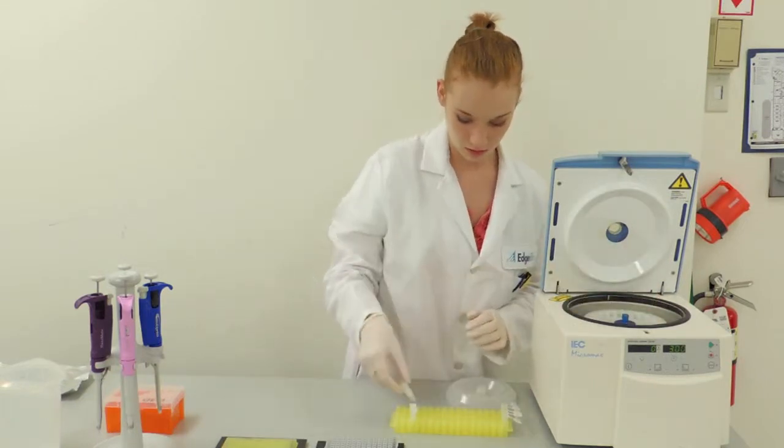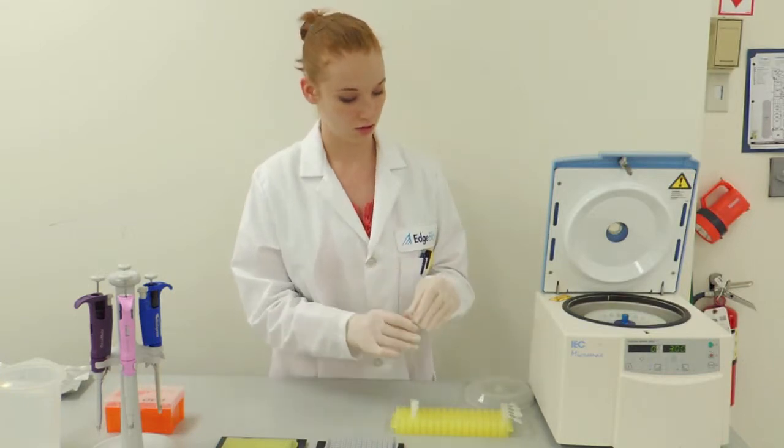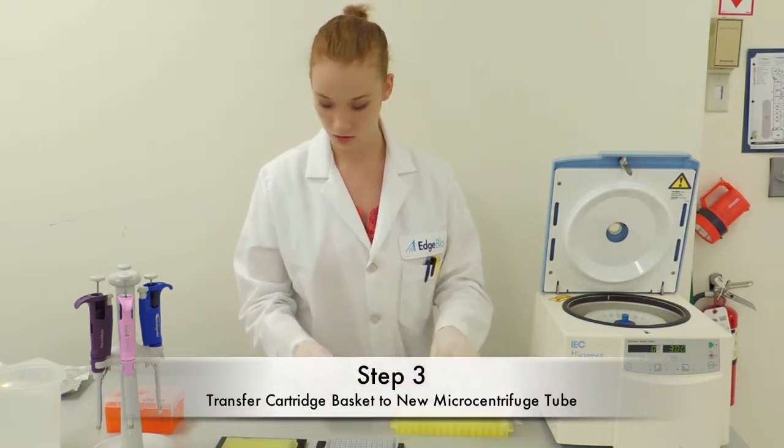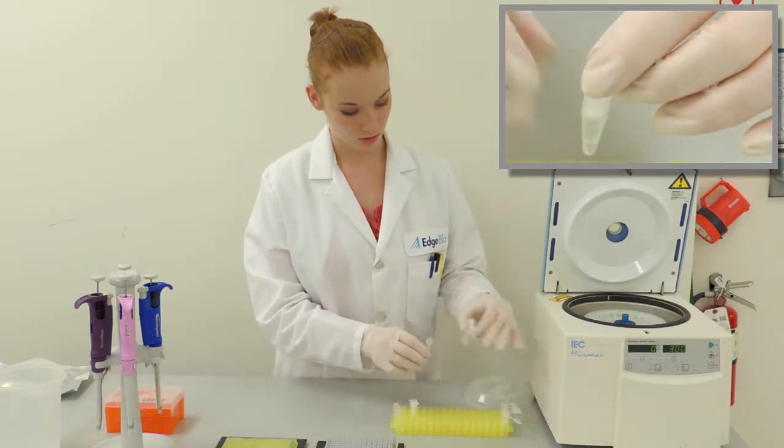After the first spin, the cartridges are removed from the centrifuge. The baskets are transferred to a new micro centrifuge tube since the originals now contain water eluate.